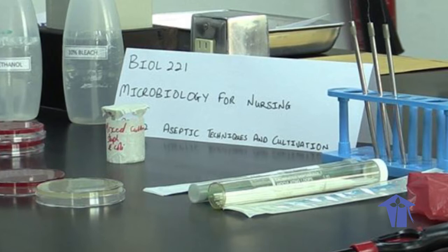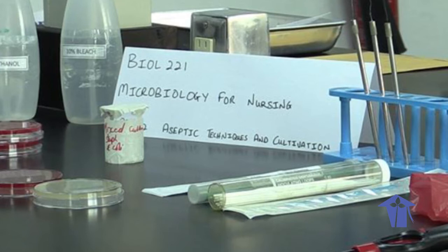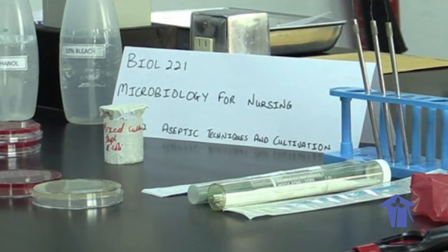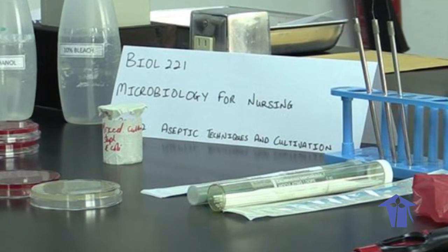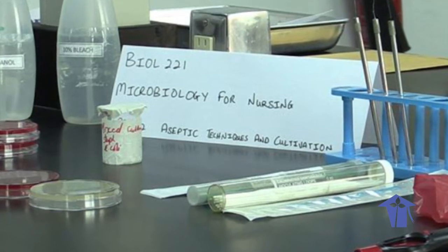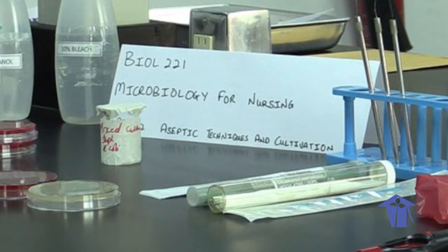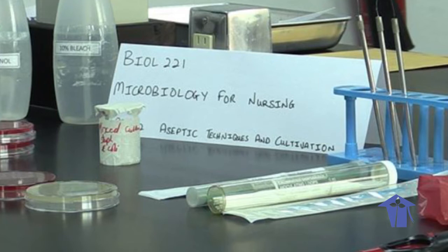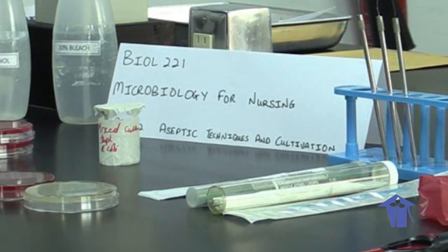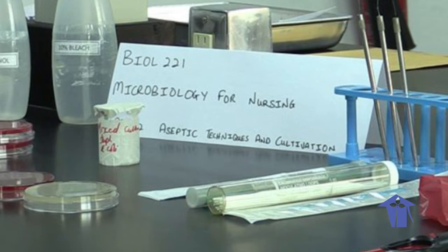Most pathogens prefer to grow at 37 degrees Celsius on solid agar, so to achieve those temperatures we typically put our petri dishes into an incubator after they've been inoculated. Liquid medium, known as broth, starts off clear. As you add culture, the broth becomes cloudy, which is known in microbiology as turbidity — the culture becomes turbid and it becomes difficult to see through, or opaque.